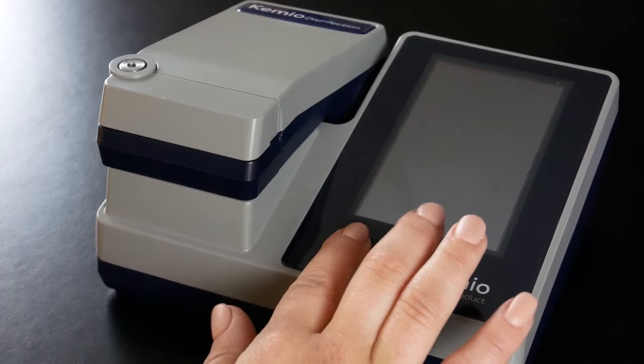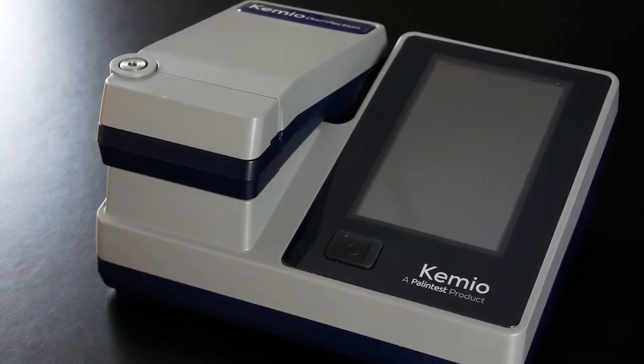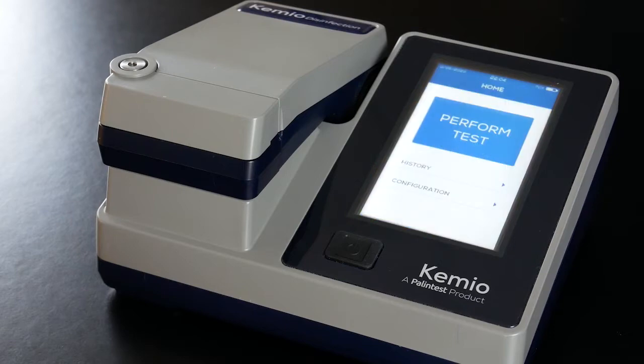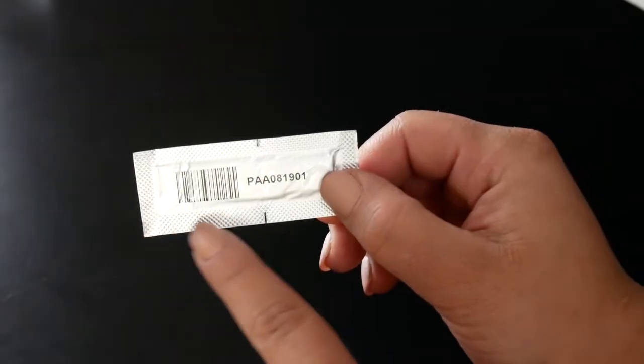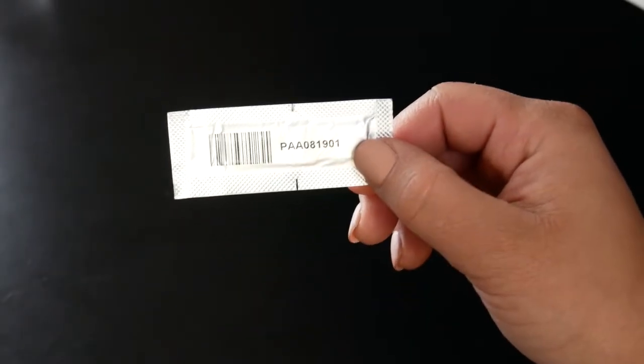Press the power button and wait for the instrument to load. The sensors are individually wrapped in foil for protection. They also have a printed barcode for scanning and traceability.